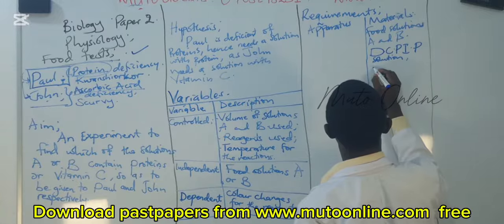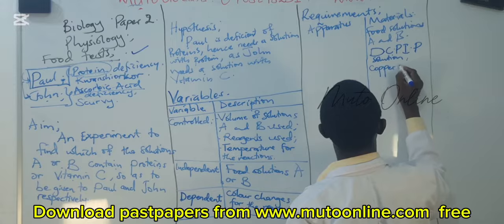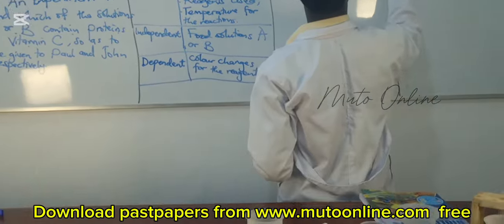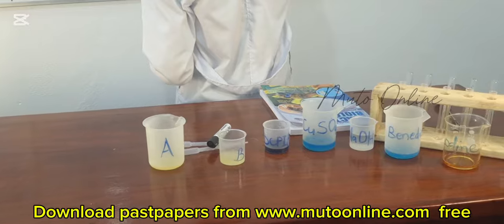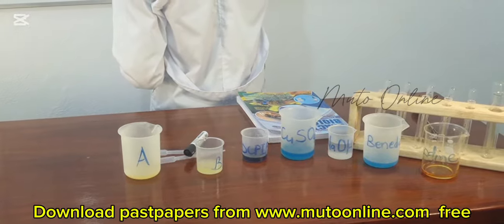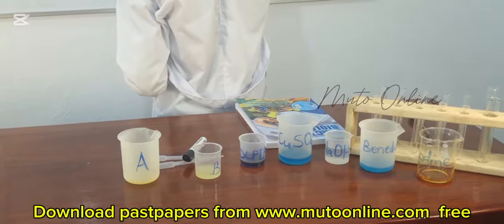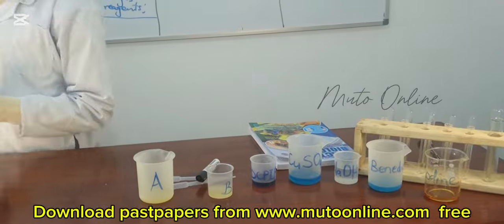We are going to use copper 2 sulfate solution. We need sodium hydroxide solution. And I think these are the only reagents we need.